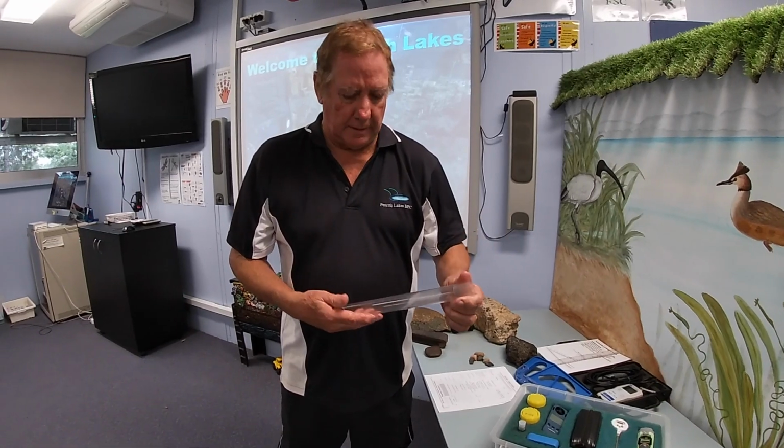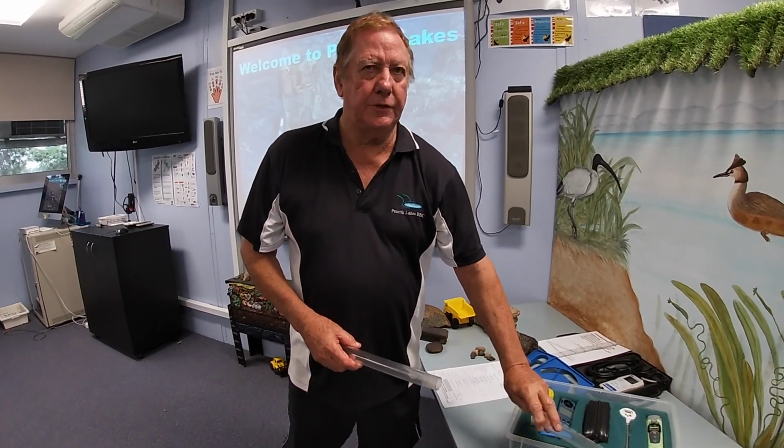The third test is to look at turbidity. Now, turbidity simply means how muddy the water is, how cloudy it is, how clear it is. So what we use is a turbidity tube. And there's a couple of things about the turbidity tube which are very important, two important things.